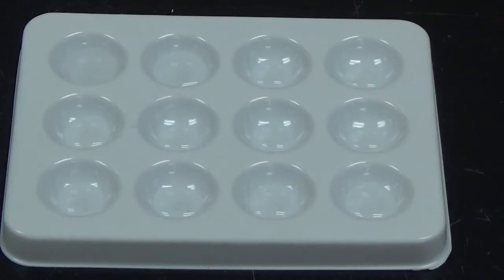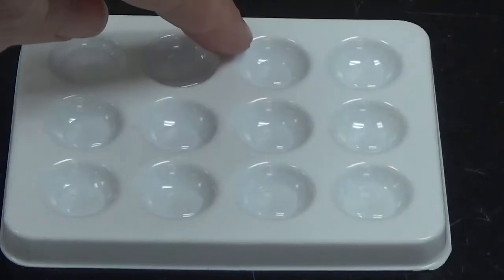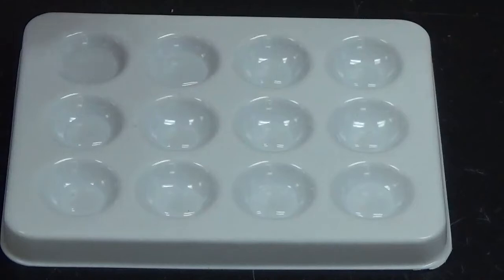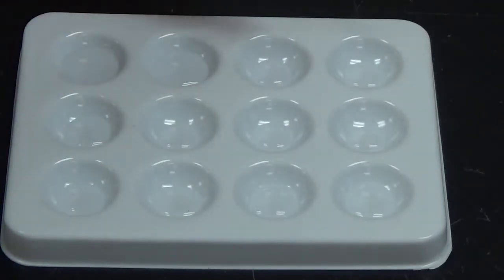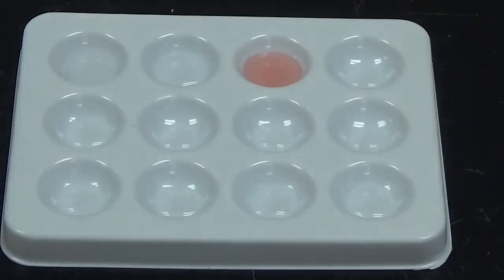So beside that, we're going to use cobalt chloride, which is CoCl2. It's going to go into this well right here. Now, please be aware that CoCl2 does have this pretty pink color. So we are going to see a pinkish color here. That is not necessarily a sign of a reaction if it gets lighter, only if it gets darker or there is some sort of solid formed or it changes a different color besides pink. And all it did was dilute that color a little bit, so no reaction there.